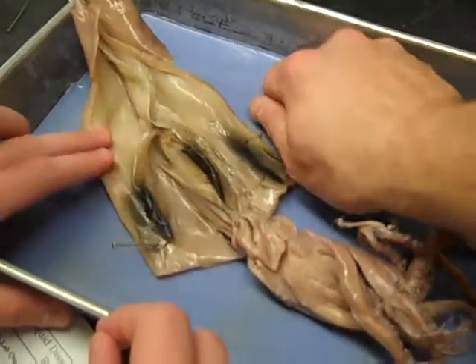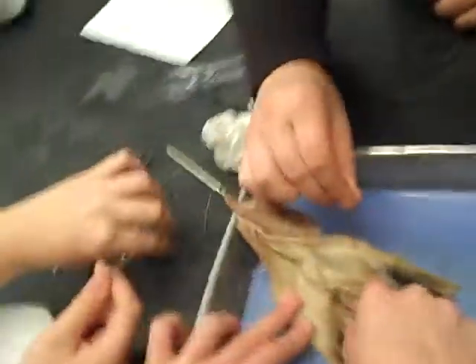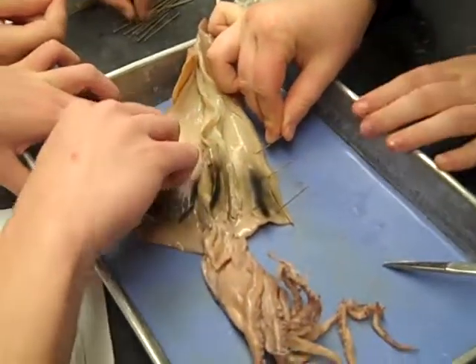Right like that. And is this one on the lungs? Not lungs — they live underwater, right? So what's that? Gills, my bad. Gills, yeah, that looks good. And when you open it up, that's pretty much exactly what you should be looking at. It's great.